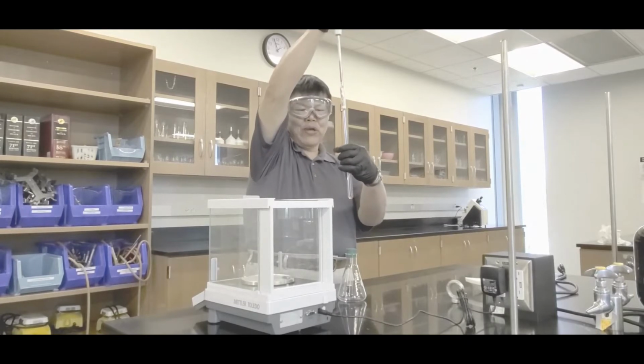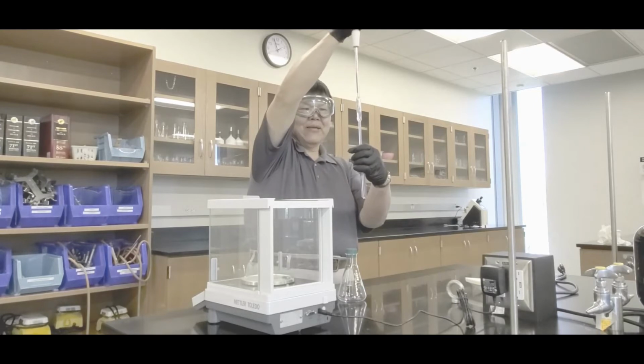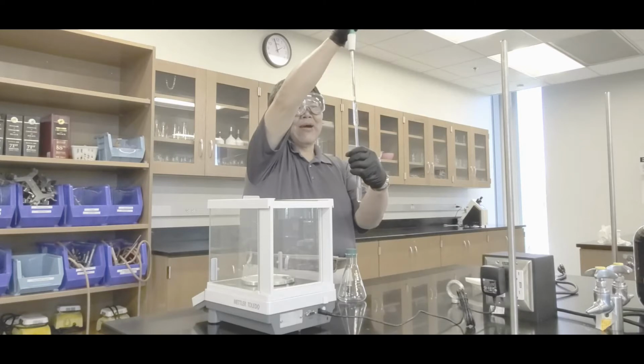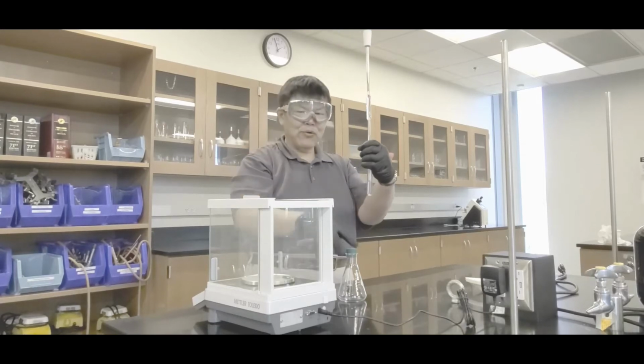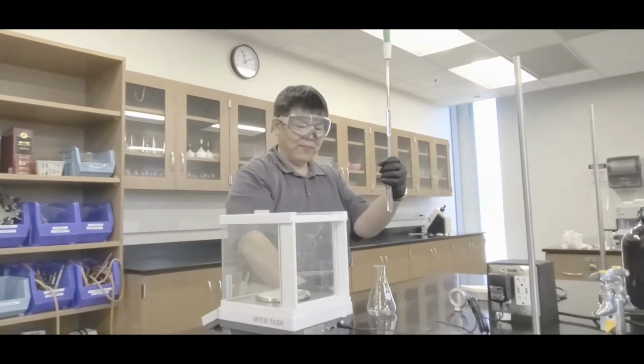And what you do is use a wheel to draw up the liquid. Okay? Like that. Draw it up as you're going down. And go past that line. There's that particular line that's on the pipette. I want you to just draw it, put it above the liquid, and then dial it back down to that particular line. There it is. Okay?